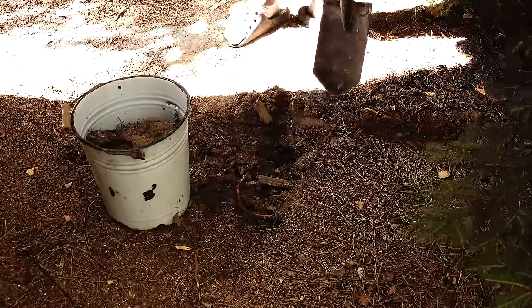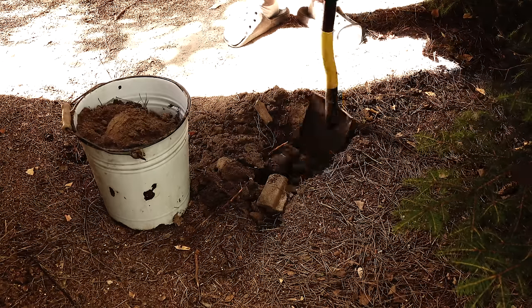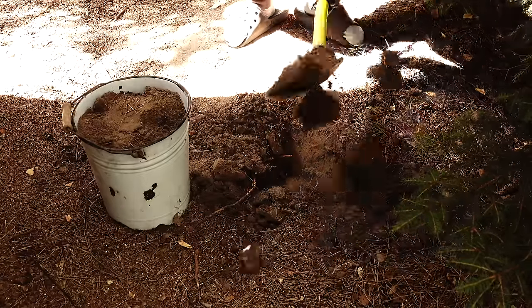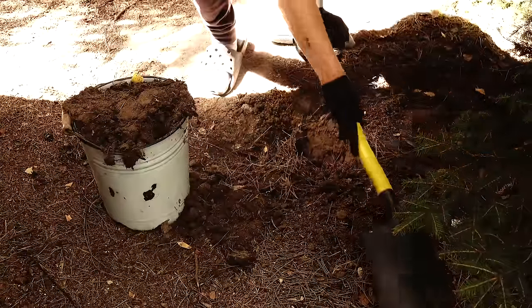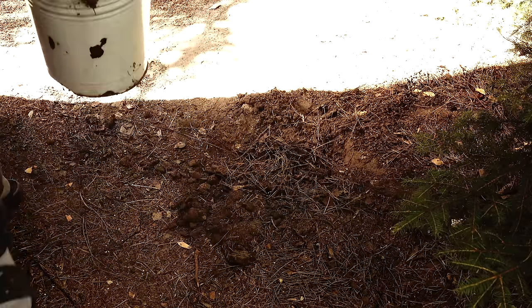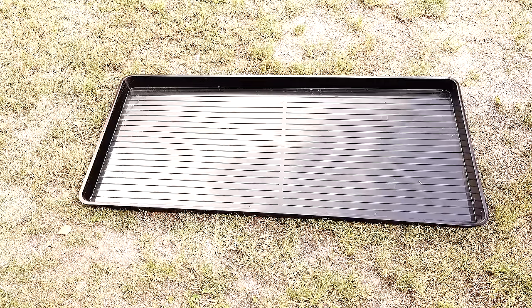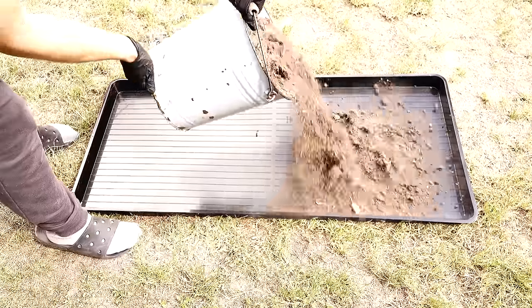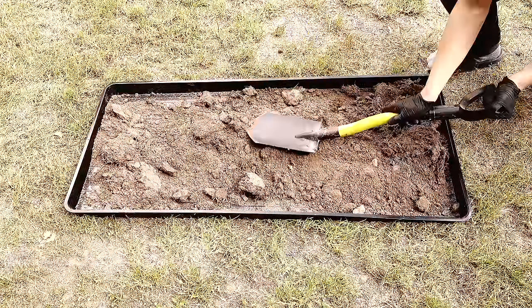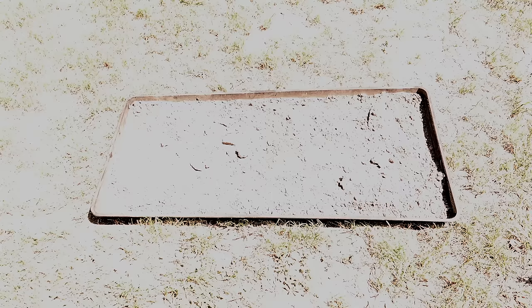It's quite funny how the chemical and normal worlds overlap here, since I am really just shoveling some random dirt into a bucket like millions of other people, but this time with the intention of turning it into a real gemstone. When I filled up the bucket, I covered the created hole so that my experiments cause less damage to the environment. Before starting to extract the silicon dioxide, I wanted to improve on the last time and first dry the dirt. This will make it much easier to clean from any larger rocks and roots, and should really ease the sieving later on. I got my big black plastic tray into the scorching summer sun and filled it up with the dirt.